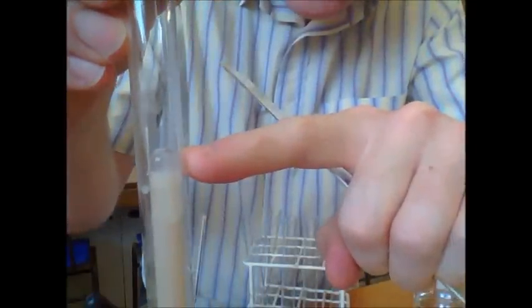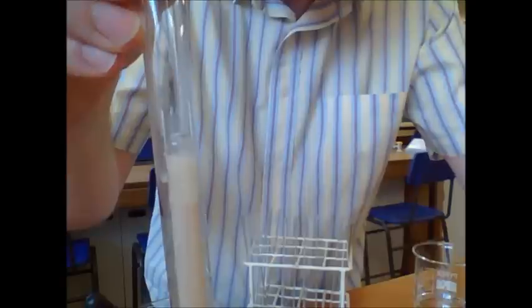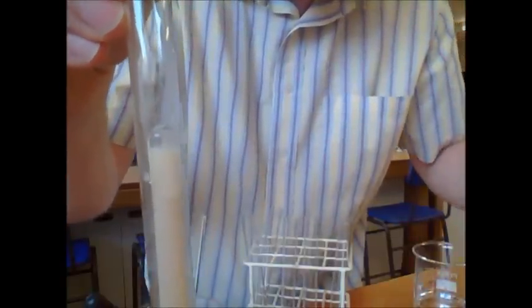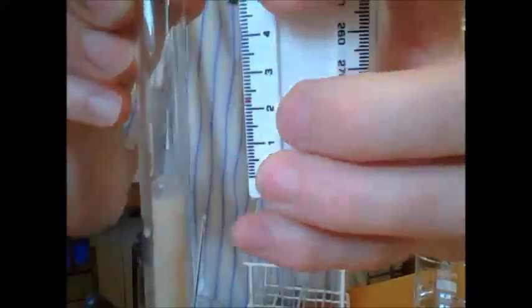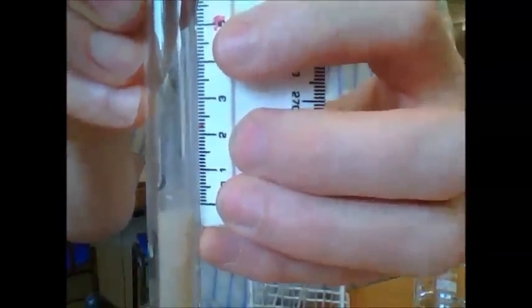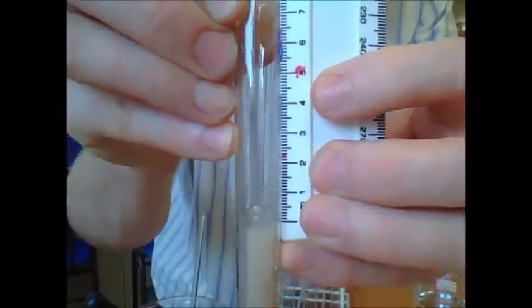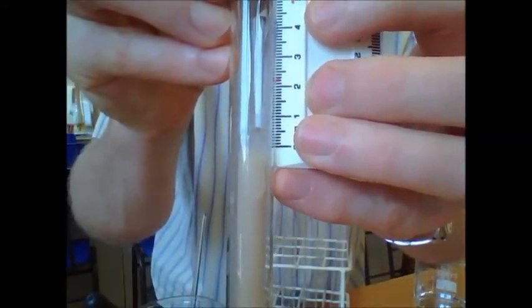You'll notice you've got a small bubble at the top here. That's your starting height of bubble. Now you'll need to measure that starting height of the bubble, which looks to be around about six millimeters.